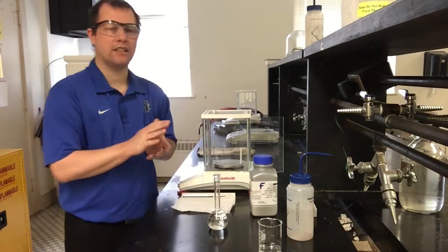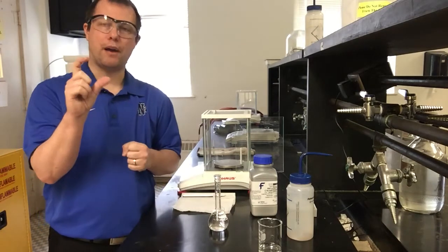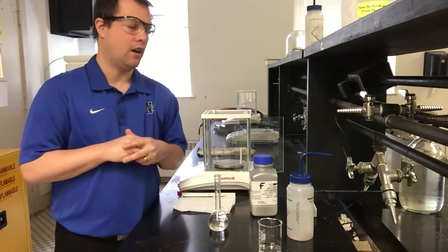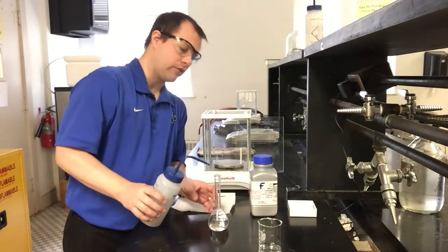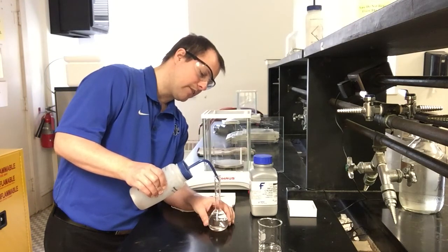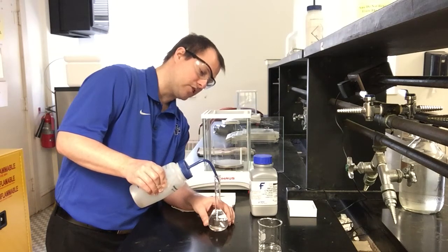For the last little bit, to get this pretty accurate, I meant to grab a little pipette that I can use to very slowly add the water, hopefully up to exactly that line. You can also use a squirt bottle if you want to be really accurate. Actually, I can probably do this with a squirt bottle here, if I have one that's thin enough. This one looks like it should work. I can very slowly add the water. The squirt bottle is actually pretty good at adding it slowly.